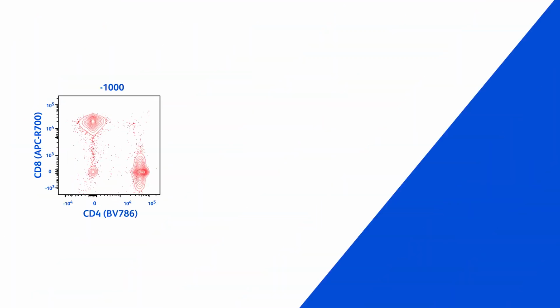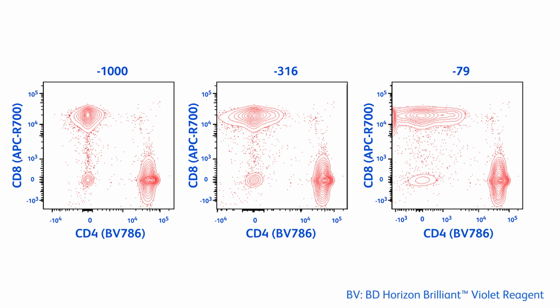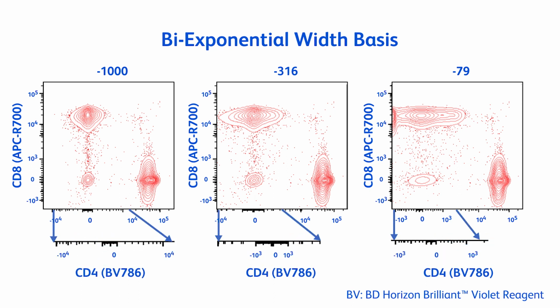Using biexponential, it is very easy to visualize whether compensation is correct and how much spillover spread there is. These biexponential mathematical models allow the user to adjust the area around and below 0 via a scaling factor. In FlowJo software, this is called the width basis. Changing the width basis will visually change the apparent spread as seen in this figure. Here we see the exact same data displayed with different biexponential width bases. The graph on the left appears to have very little spread in the x direction, while the one on the right has a lot. These are the exact same data. Notice the values around 0. The data on the left are more compressed around 0 compared to the right.